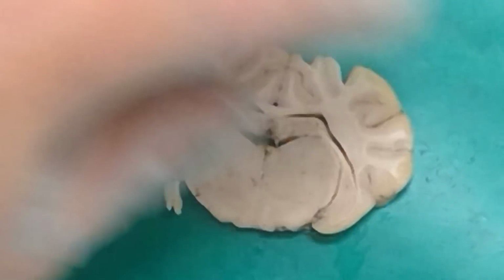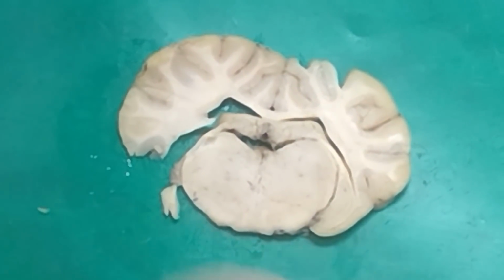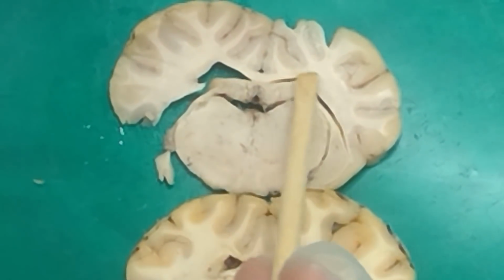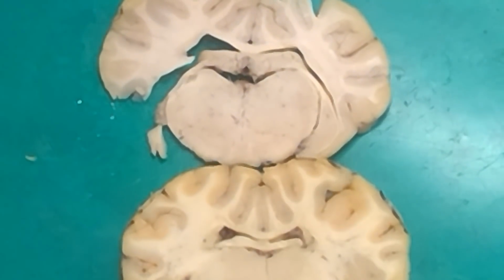Just said it. The little lines that are white matter is the fornix. When it's gray, what is it again? The hippocampus. So when it goes to like being like that, this is now hippocampus up here. Versus when it looks like this, that's more like fornix. When it's white like that, it becomes hippocampus when it looks more like gray matter up there. Yeah, and it's also on the bottom here because it's kind of shaped like this, where you got a top part and a bottom part.